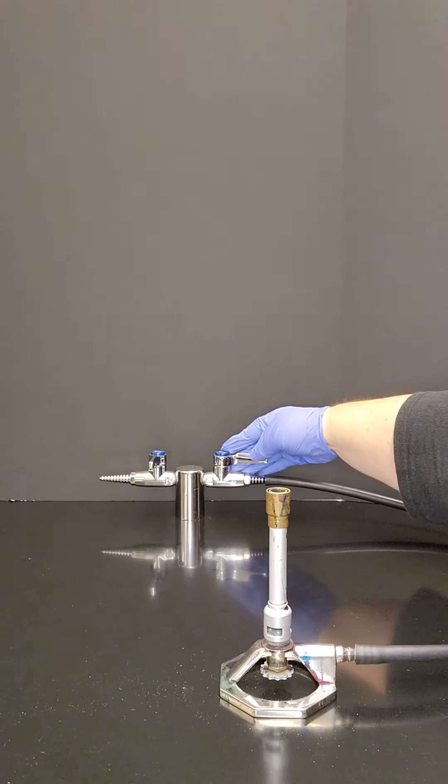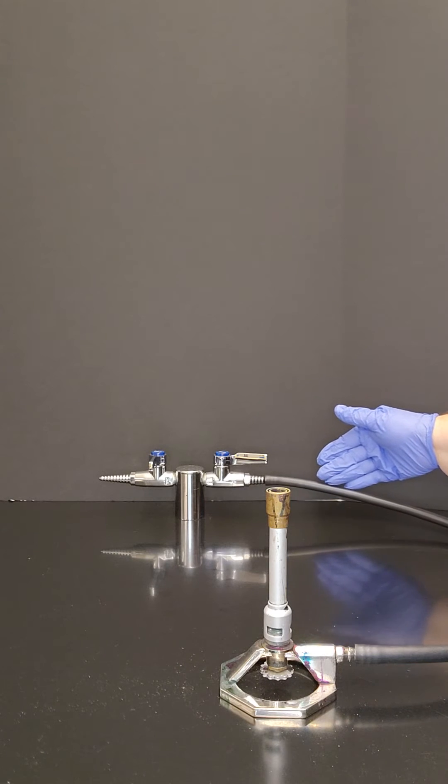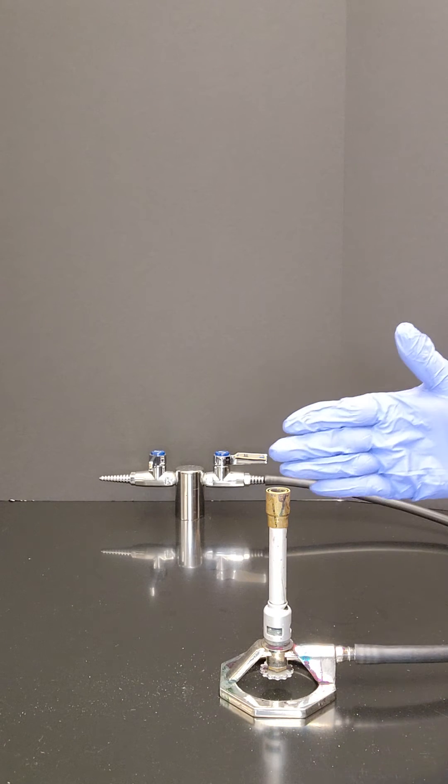Turn your gas on all the way so that the handle is in line with the hose. Give the gas a few seconds to travel along the hose to the burner.